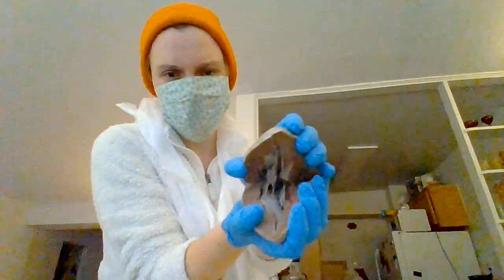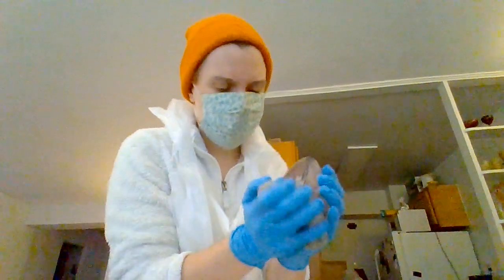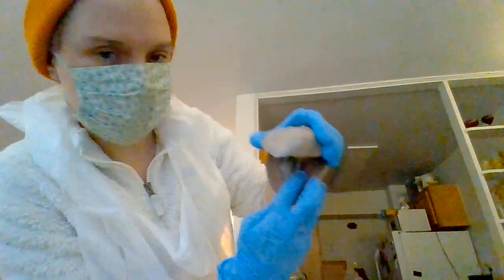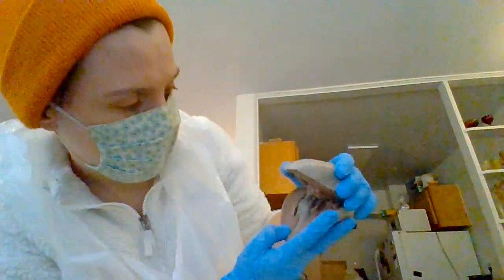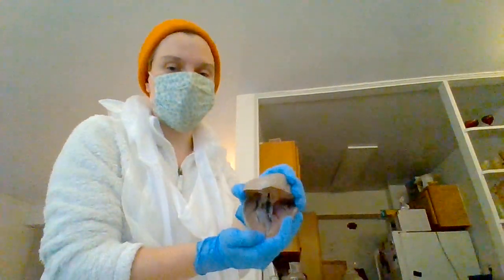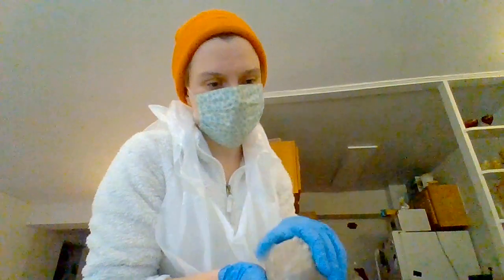You can kind of see these structures here. It's a little tricky, but there's a lot of stuff in there that we do need to talk about, so let's get into that. The first thing we're going to talk about is right here. It's the interventricular septum, and the interventricular septum separates the ventricles from each other, so it's a pretty straightforward name.